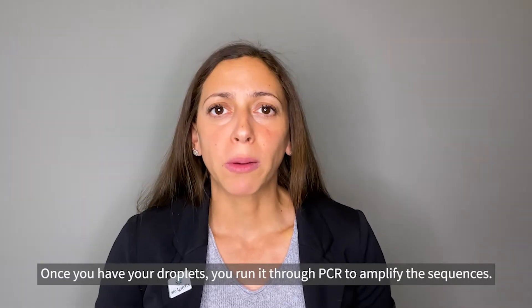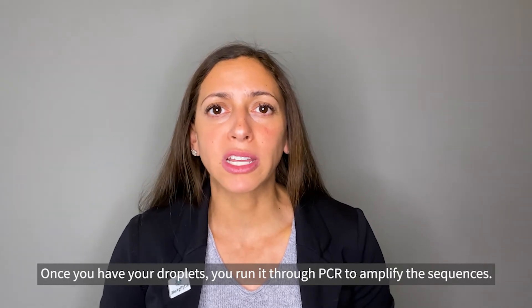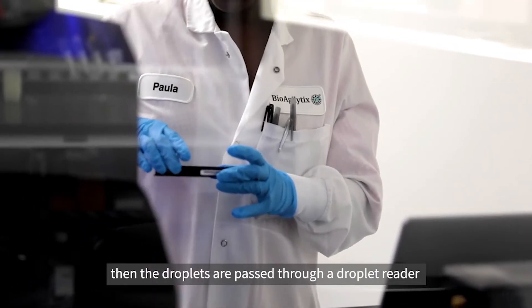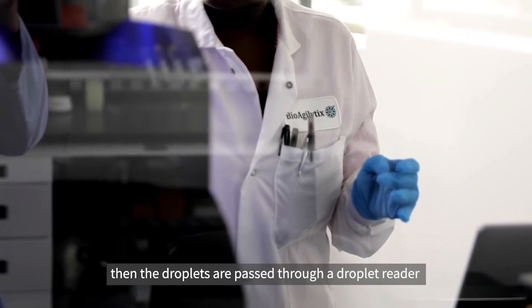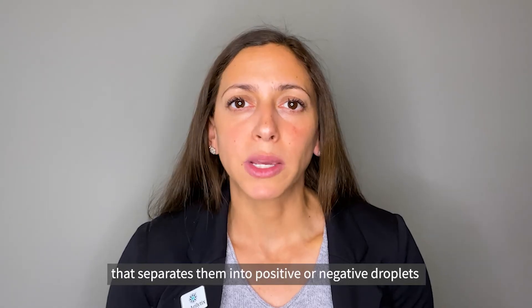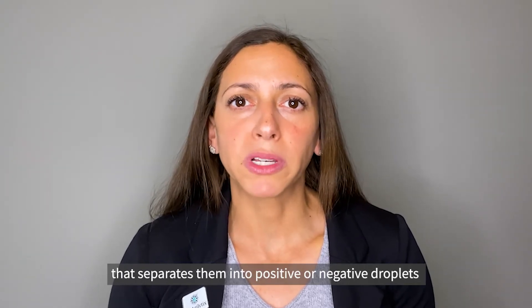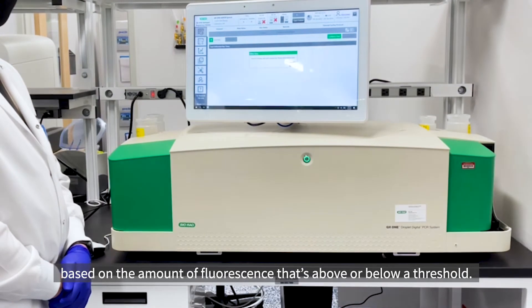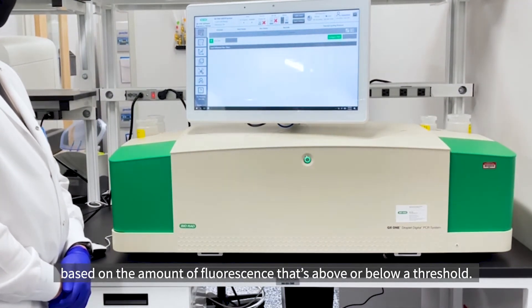Once you have your droplets, you run them through PCR to amplify the sequences. Then the droplets are passed through a droplet reader that separates them into positive or negative droplets based on the amount of fluorescence that's above or below a threshold.